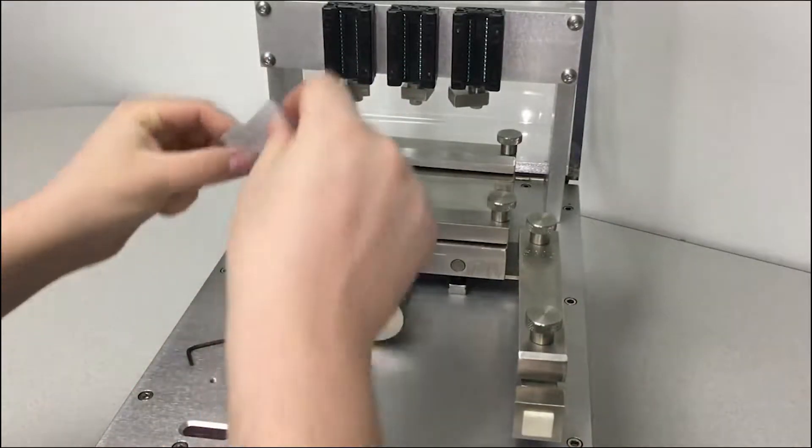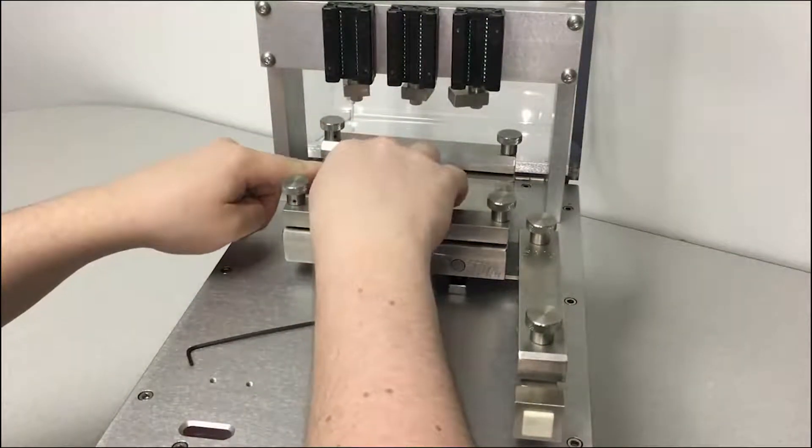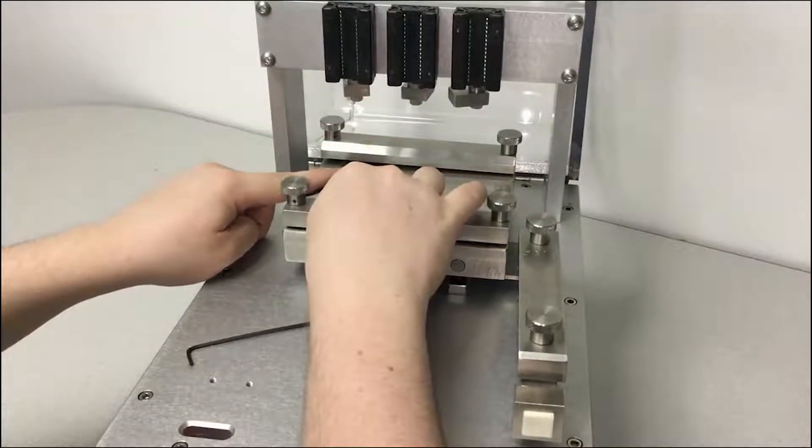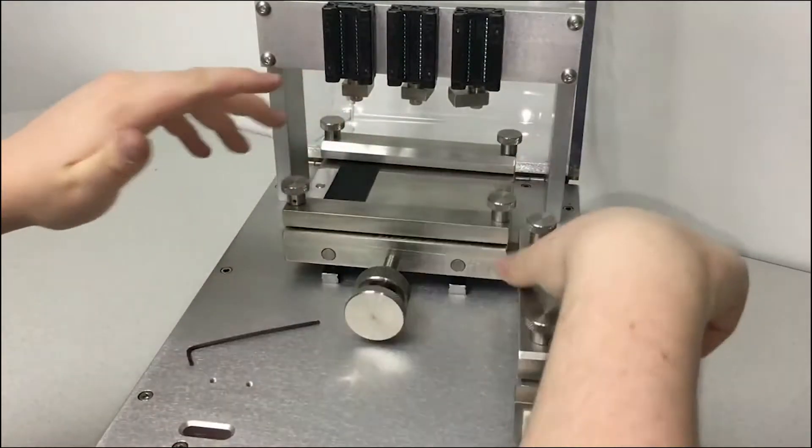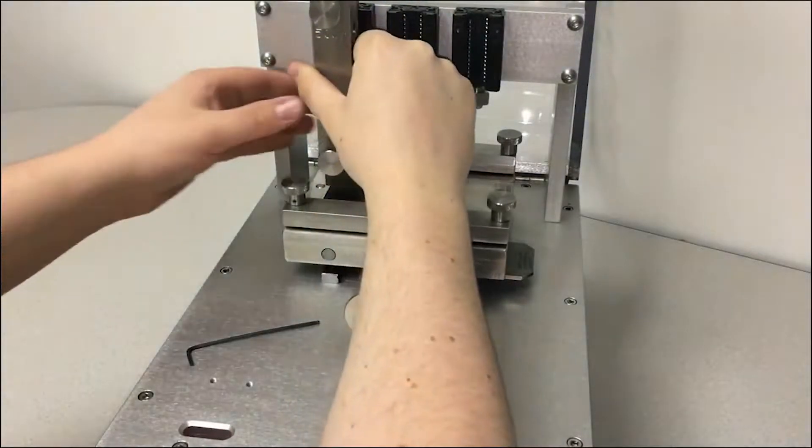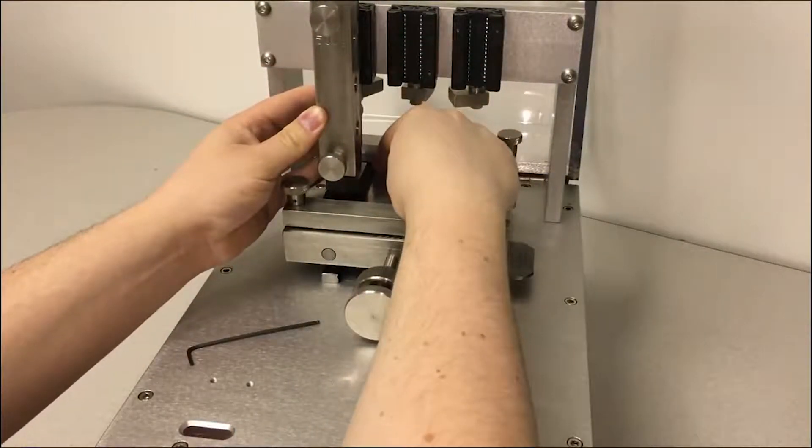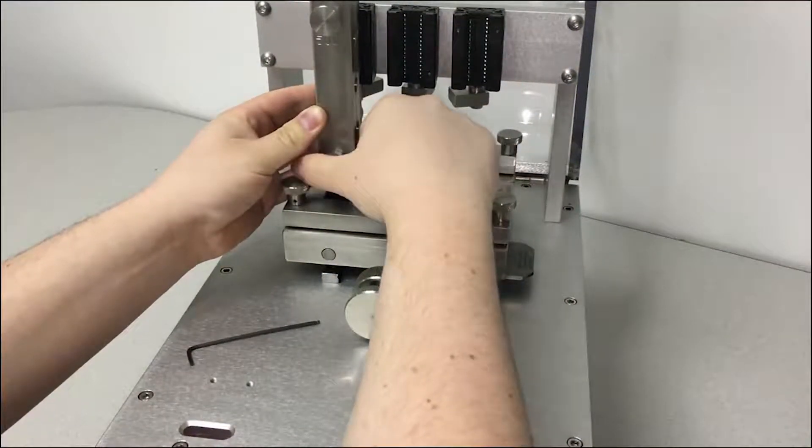Then we need to install the specimen. Now I find lining it up by eye a little bit hard. So what I do is I bring the arm down and then that gives you a much better frame of reference for your test and where it should be placed.